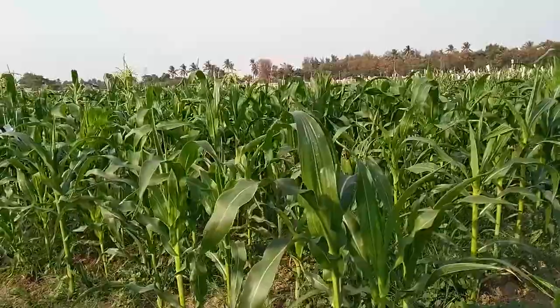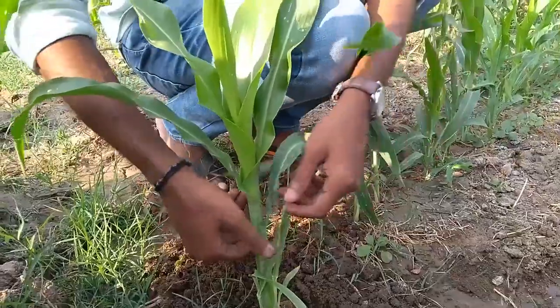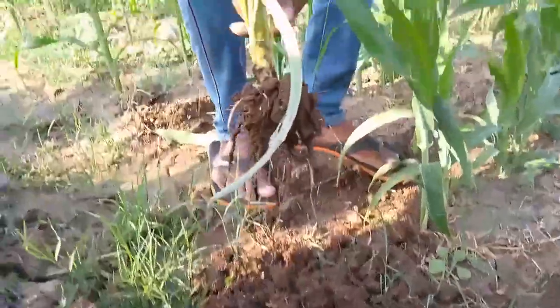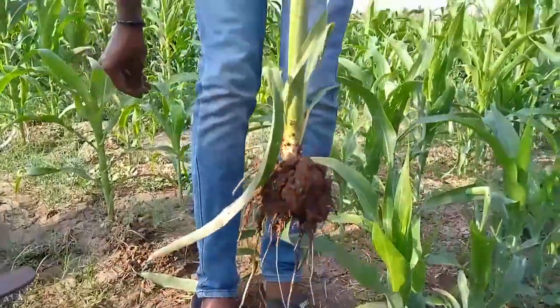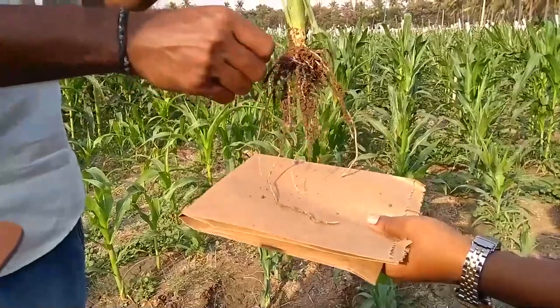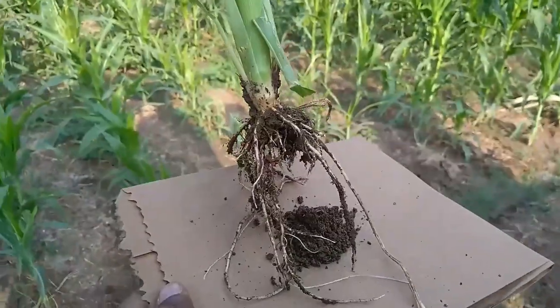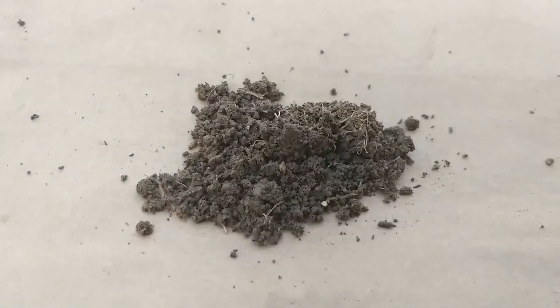Here we have chosen the maize crop which is two months old. Pull out the maize plant from the field. Gently tap the rhizosphere soil which is adhering to the root system for isolation of microbes.